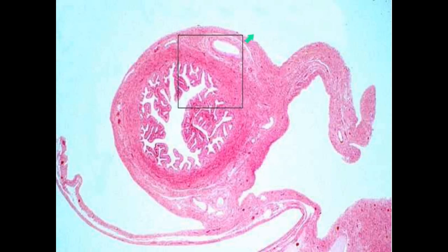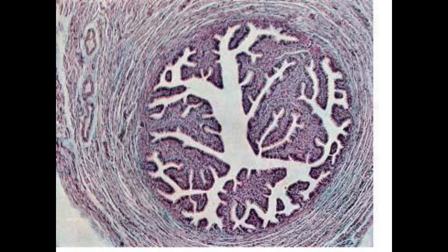And finally, we have the serosal covering of the peritoneum. Again, the mucosal folds, simple columnar, partially ciliated, partially secretory, connective tissue corium, and then the muscle tissue. And finally, we have the covering of serosa. The muscle is formed of inner circular and outer longitudinal, but we cannot see here the longitudinal bundles so clearly.